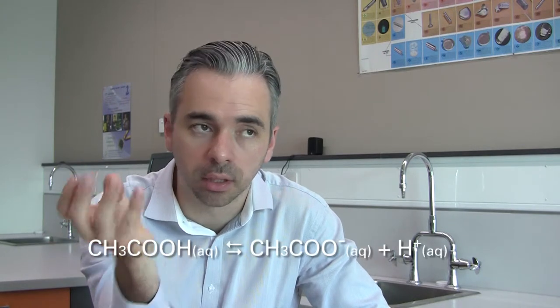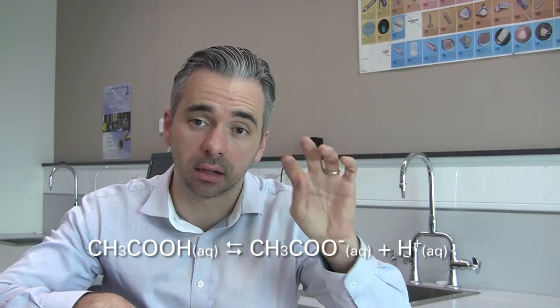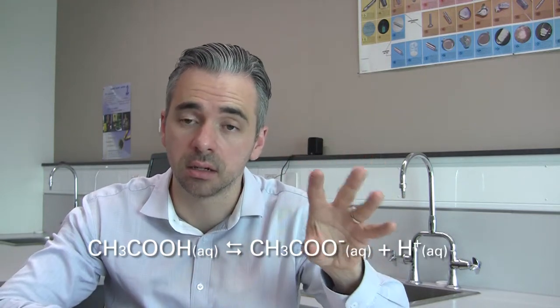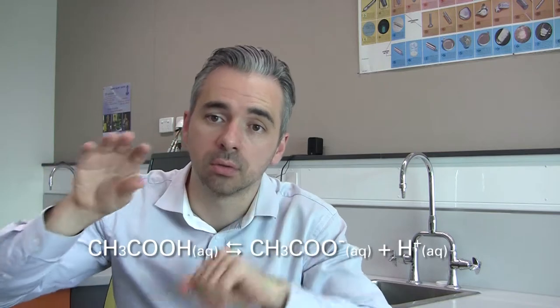If you haven't already, it's good to have the dissociation equation up on the board, showing that acetic acid, or ethanoic acid, dissociates to give the acetate ion plus H+, and relating that H+ to pH.